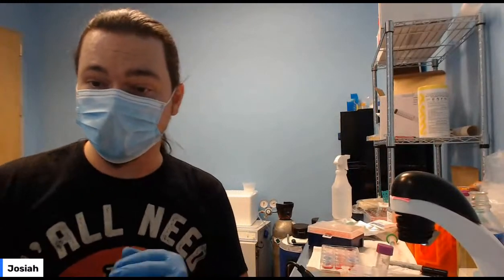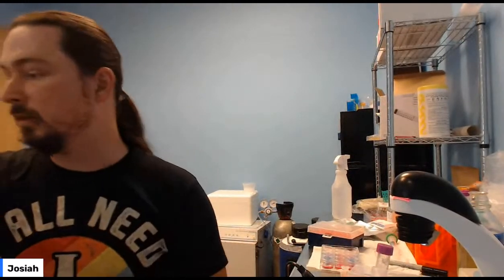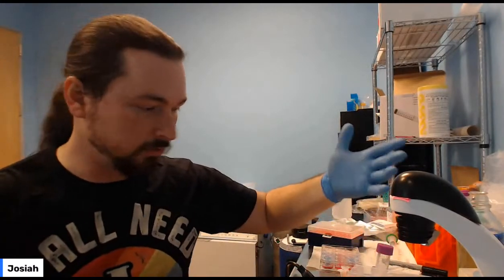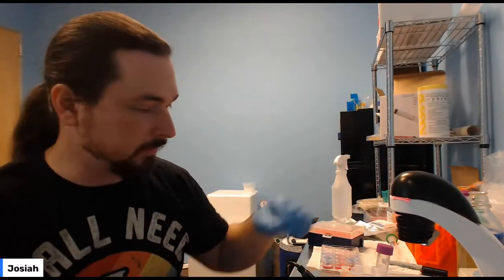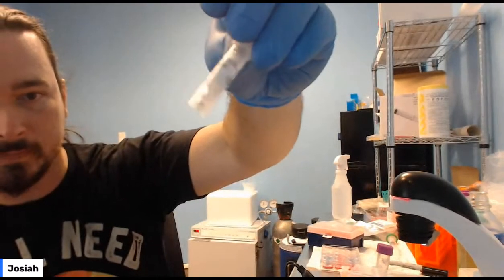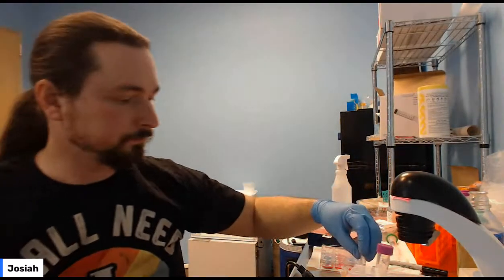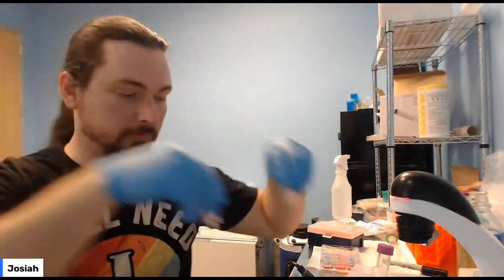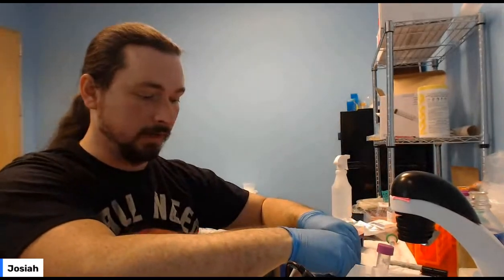Yes, I did say pipette up and down when you're reconstituting the LAC-Z with water. Whatever you've got to do to get it mixed up. It should go from looking like a dry tube with maybe a weird yellow thing on the side to looking like pale yellow water. Okay, so these are now going to incubate at room temperature for 10 minutes. These four.